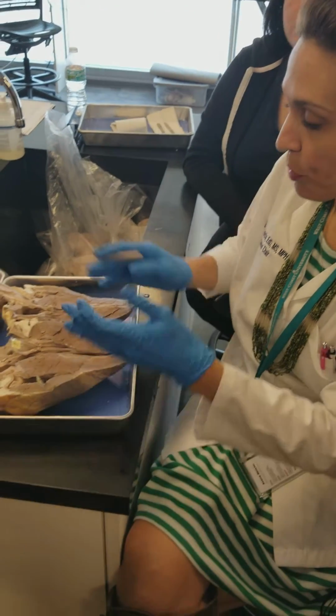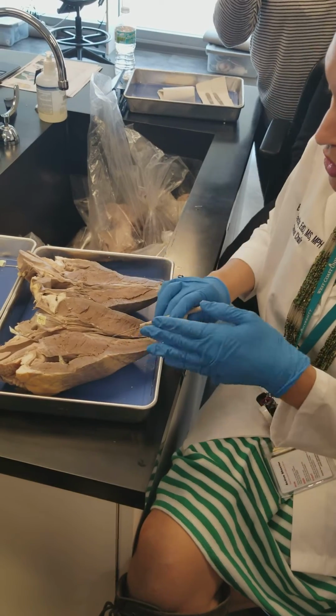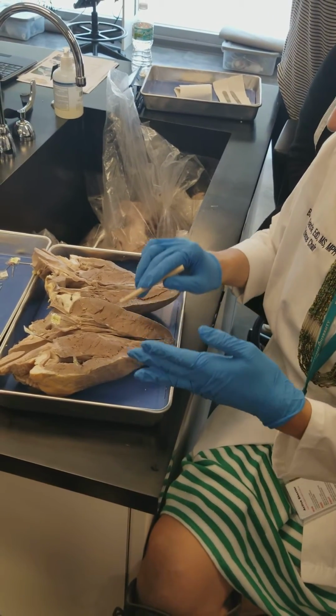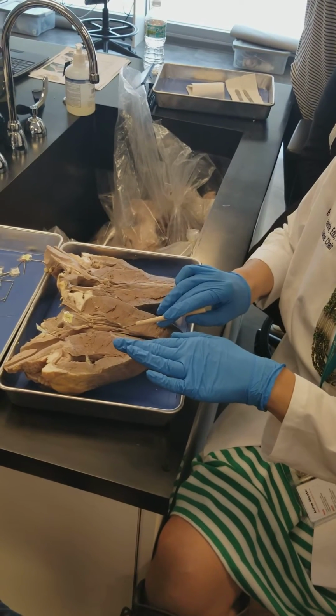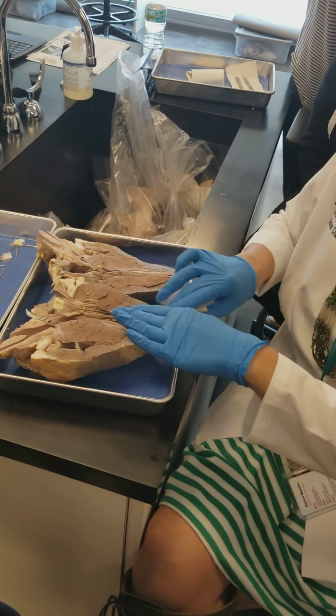Also the left ventricle. Because remember, we cut it in half. So it's like half the left ventricle is on one side and half is on the other. Right? So if this is the left ventricle, that obviously by default leaves that to be the right ventricle. Right ventricle at the top? This is the left ventricle.